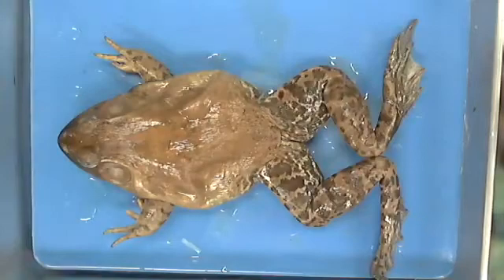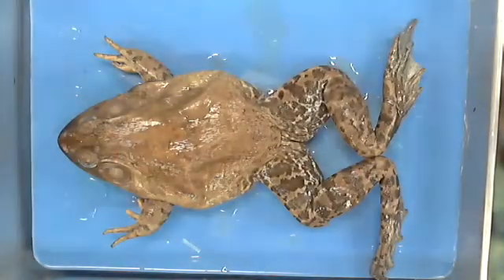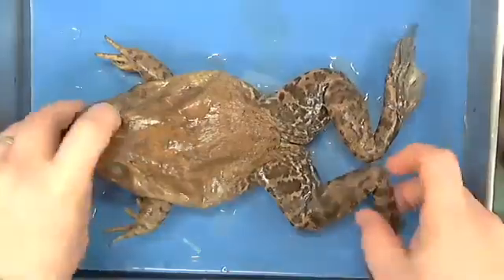Record button and shift there and there, and it should be new camera. And let's see. Yes, there's a frog. All right, so everybody can still hear me. By the way, I'm going to flip him over.